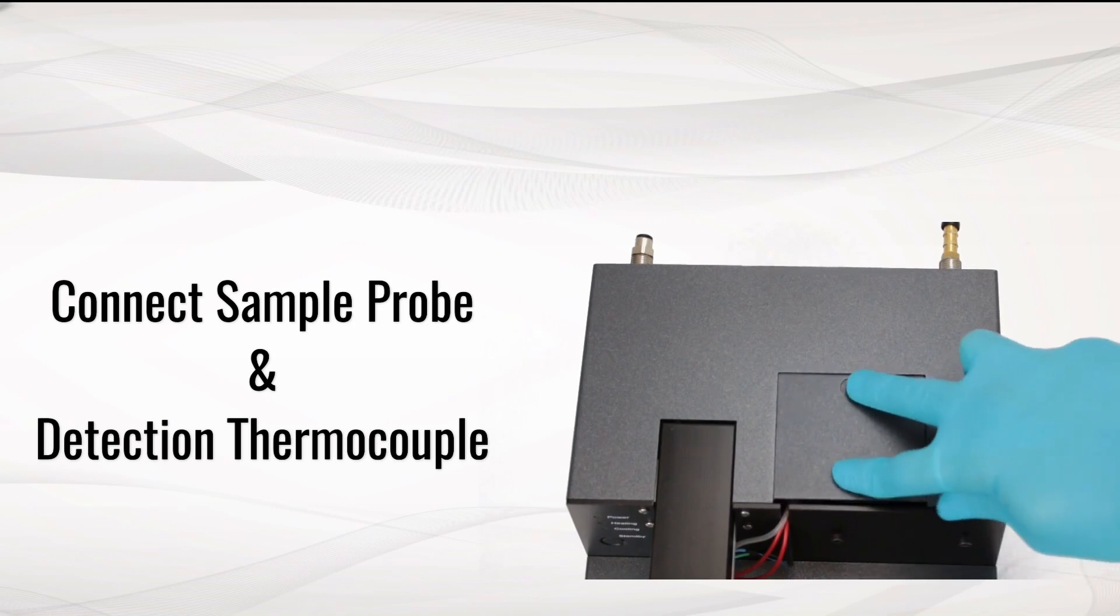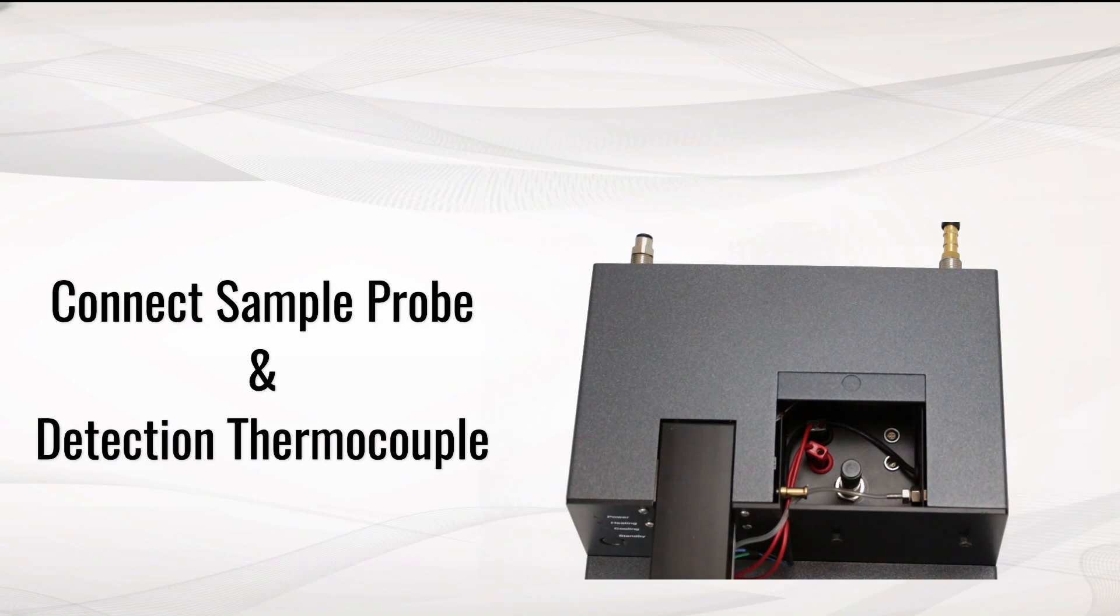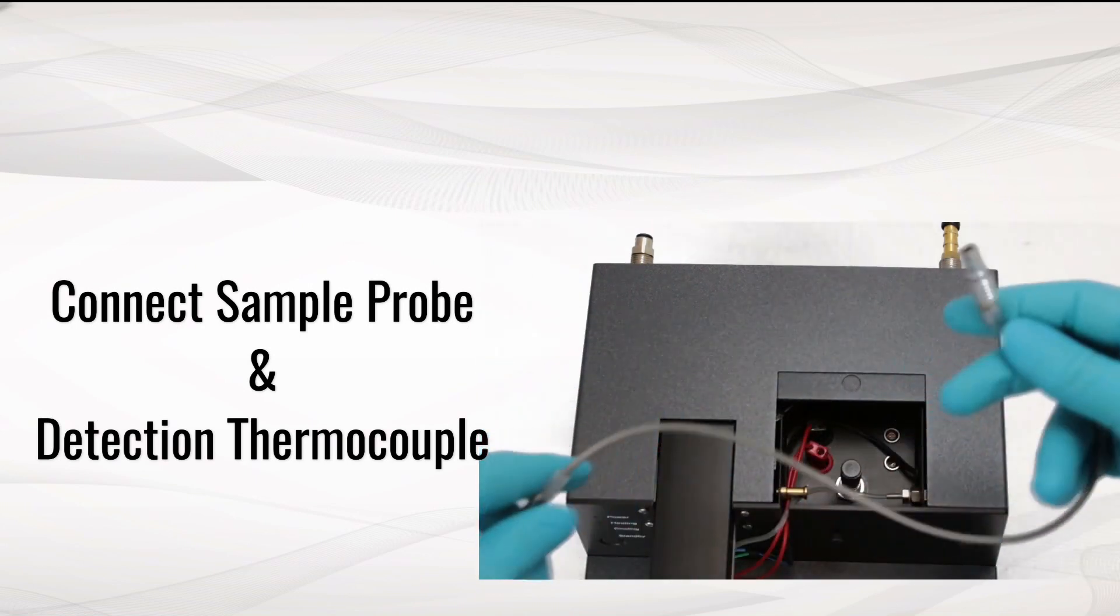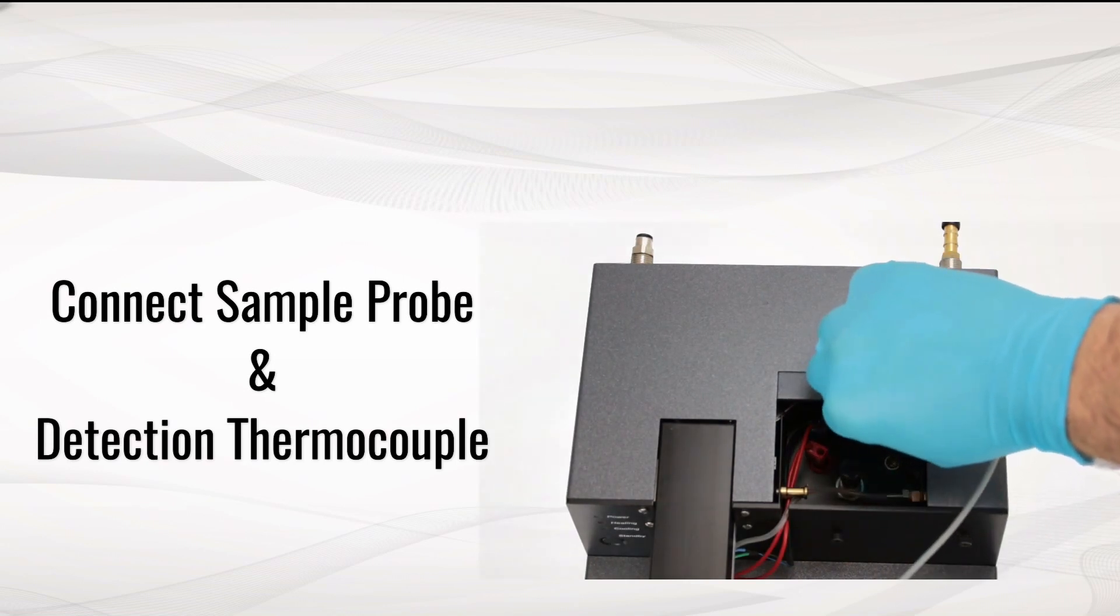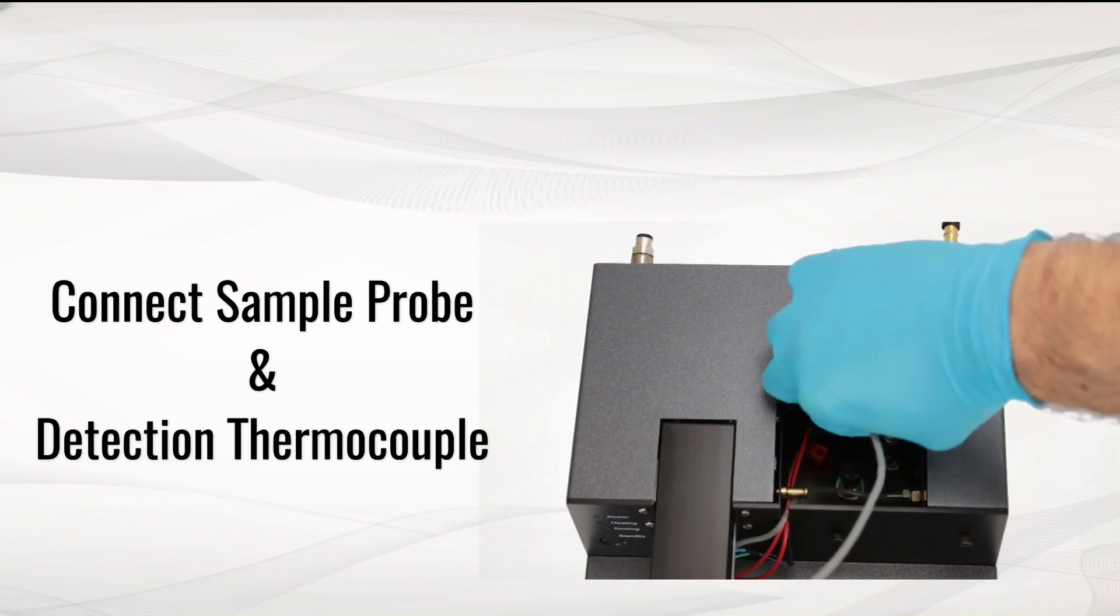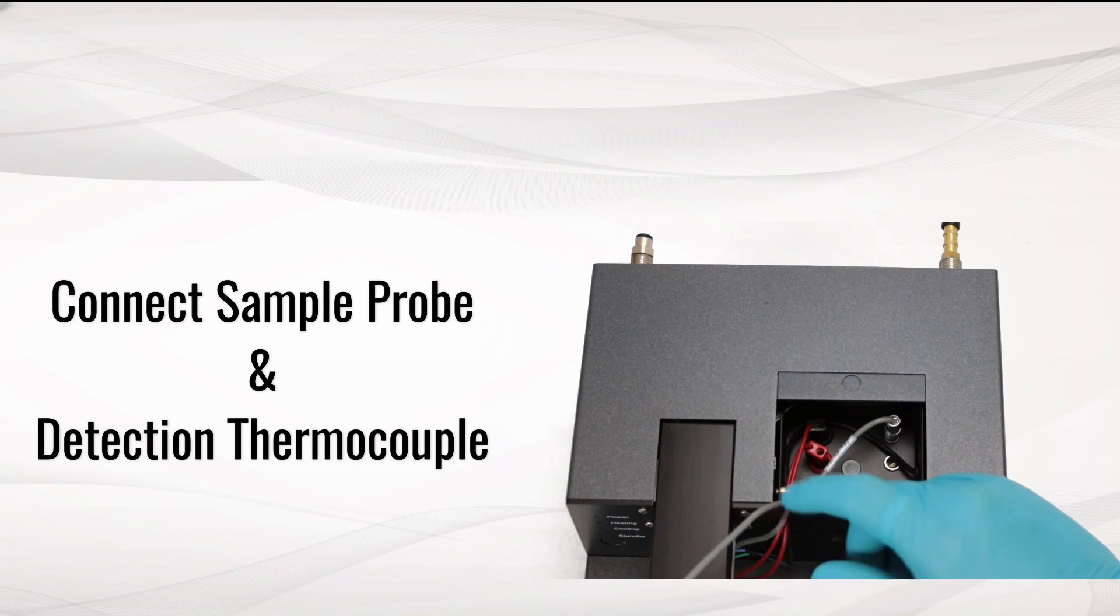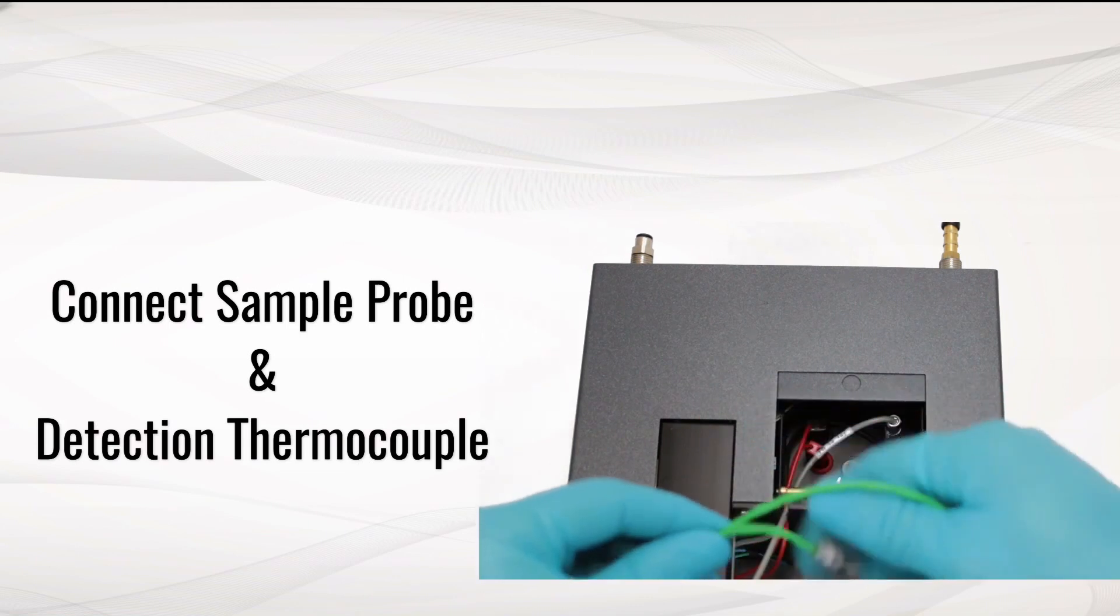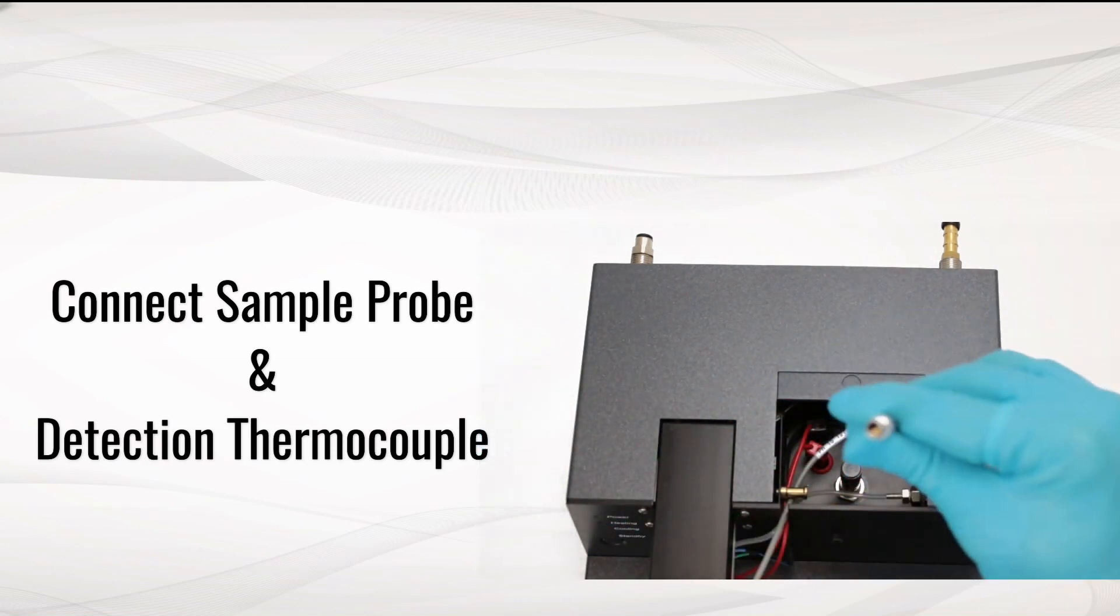Slide the top panel in order to access the connection area. Plug the sample probe and pass the cable through the opening. Process in the same way with the detection thermocouple.